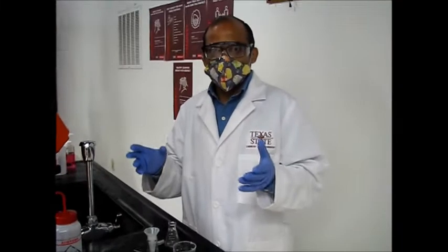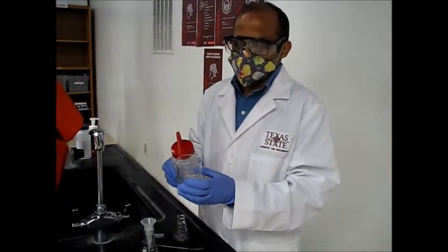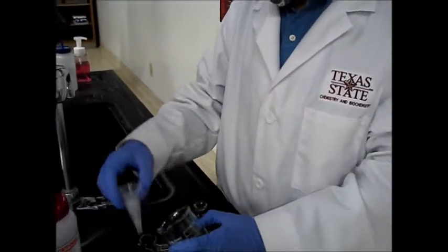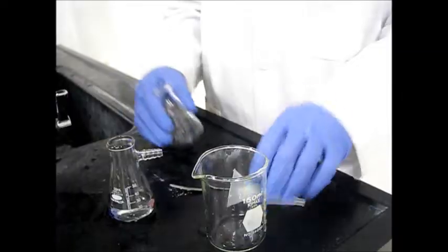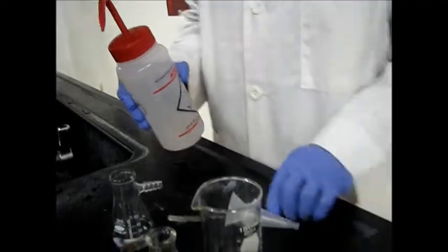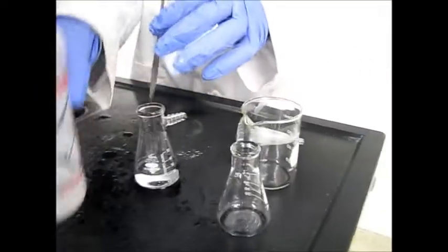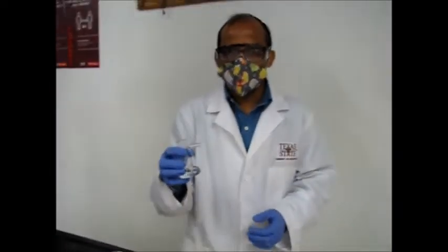Okay, now the very important part of this lab is the cleaning of the glasswares. For the cleaning of the glasswares, this is the benzoic acid and copper sulfate. So first we will rinse with acetone and then place all this here. You can rinse all the glasswares with acetone first, and then your spatula as well. And now, don't throw this into the sink, we will throw this into the aqueous waste. So let's go and put it there.